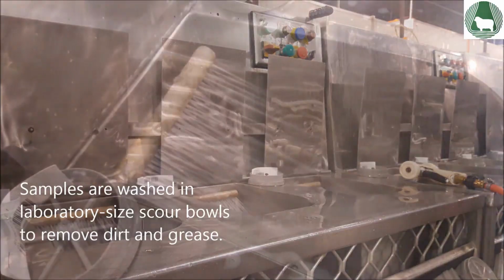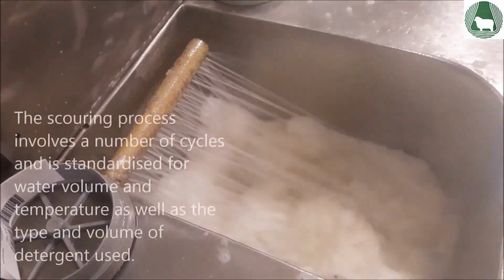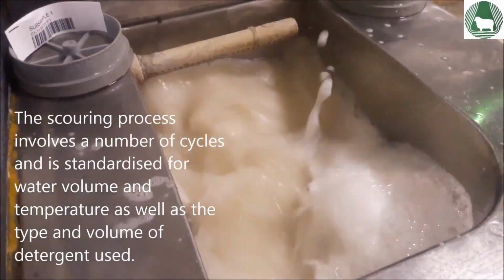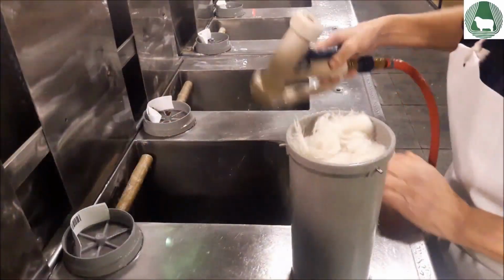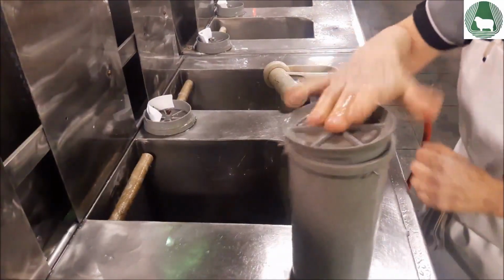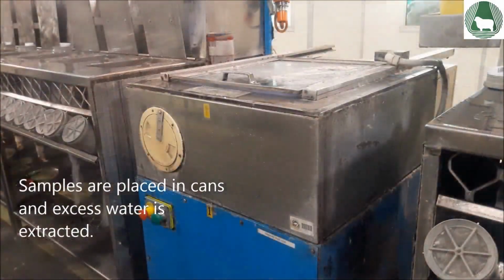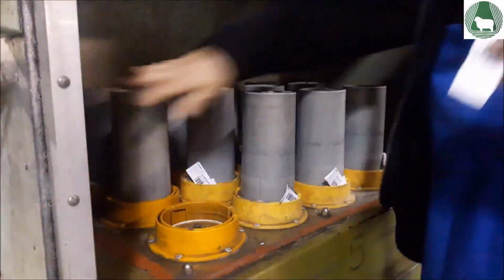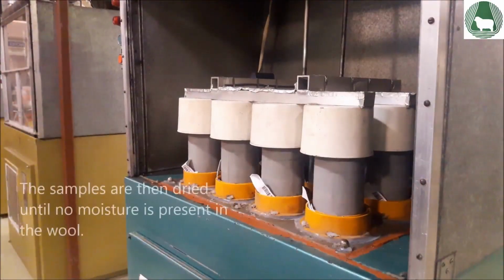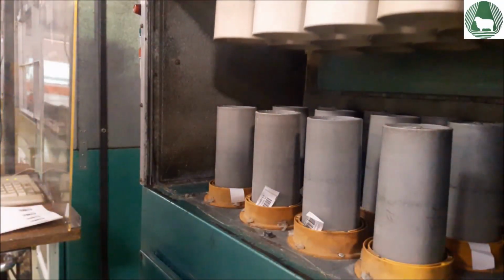Samples are washed in laboratory-sized scour bowls to remove dirt and grease. The scouring process involves a number of cycles and is standardized for water volume and temperature, as well as the type and volume of detergent used. Following scouring, the samples are placed in cans and excess water is extracted. Samples are then dried until no moisture is present in the wool.